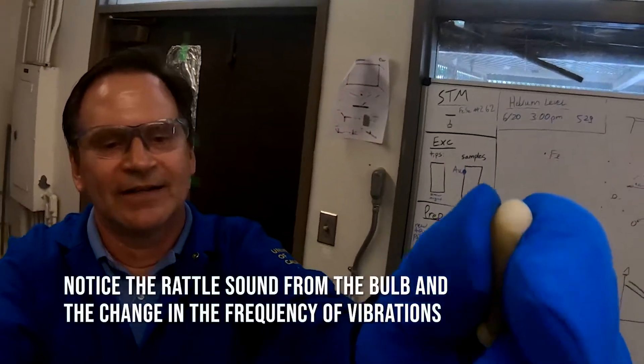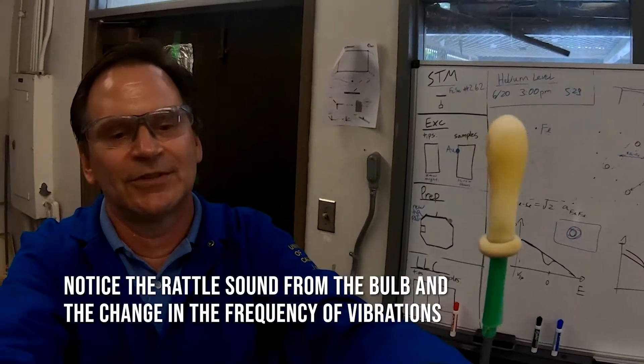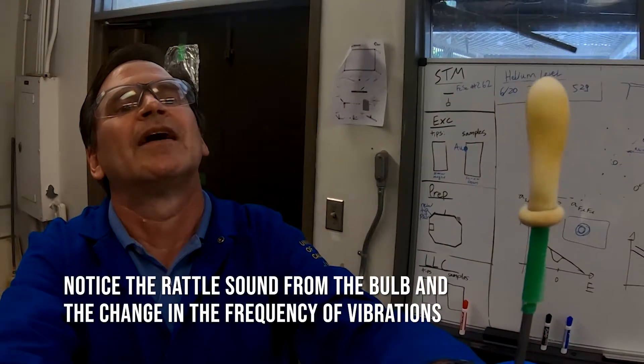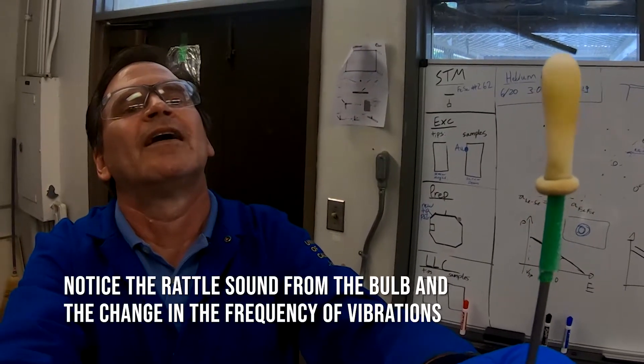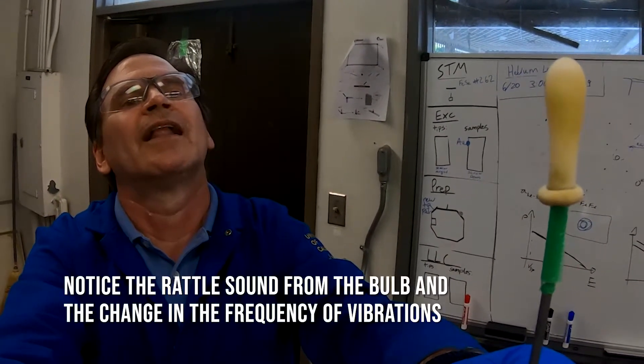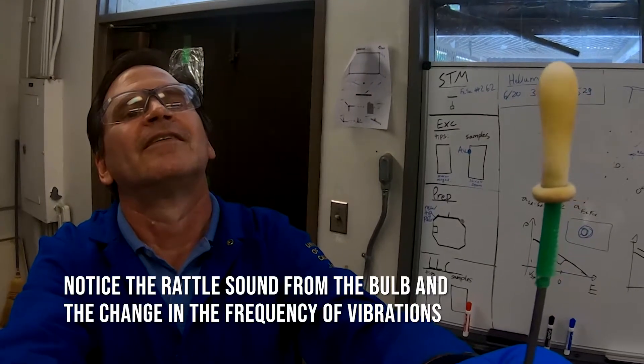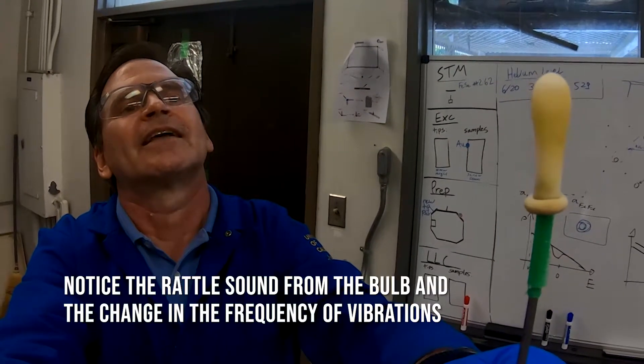So it's in the liquid right here. It's actually right there. This is almost empty dewar. There's above and there's below, above below liquid level, above at the liquid level.